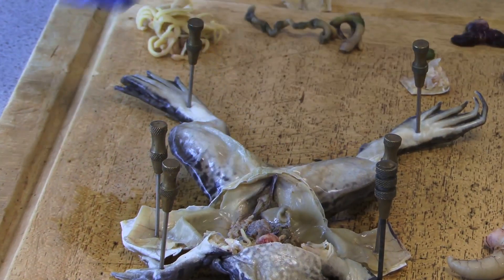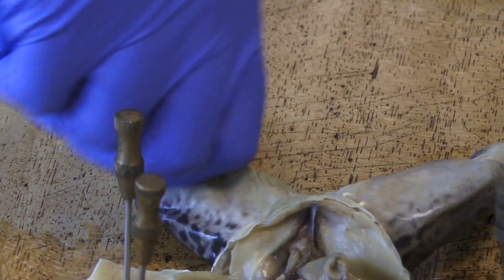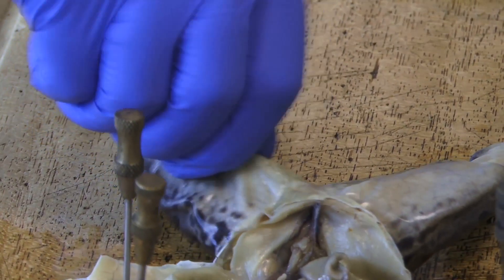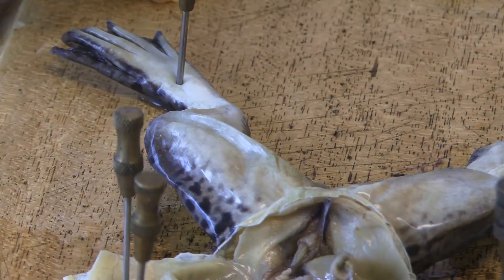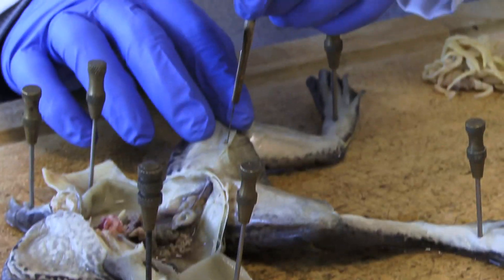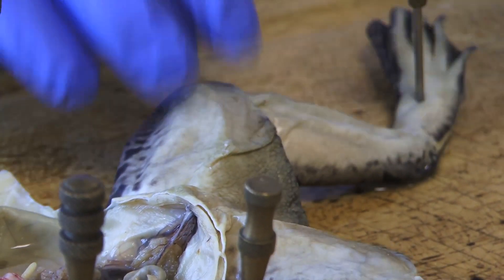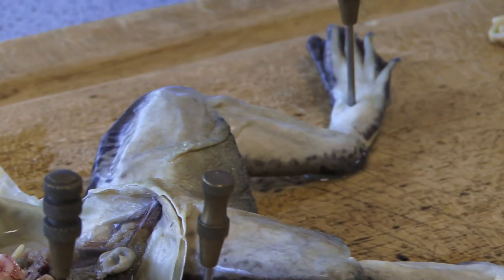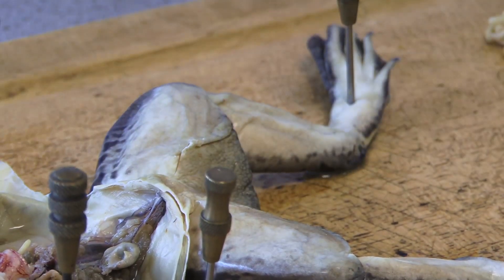Similar process as we did before — if we can just pinch up to make sure we've got a nice dissective compartment. Then gently giving the incision, and once we've got the incision we can then continue as normal to have a look at the internal structures of the muscles of the thigh and the leg.